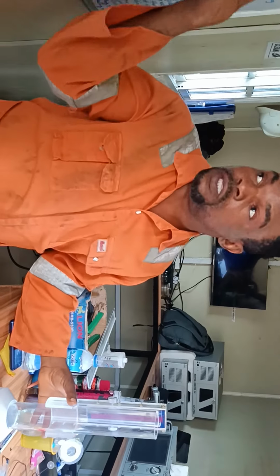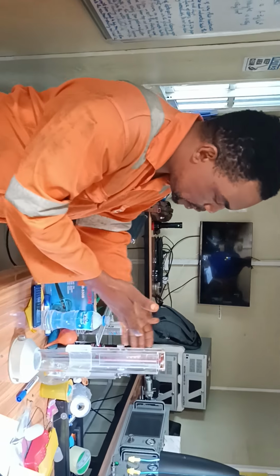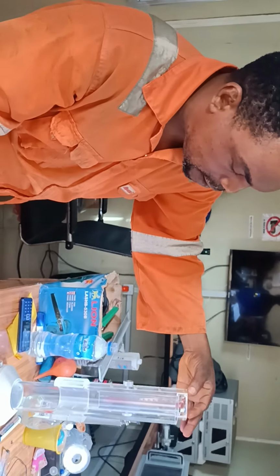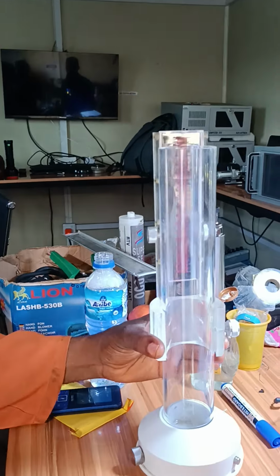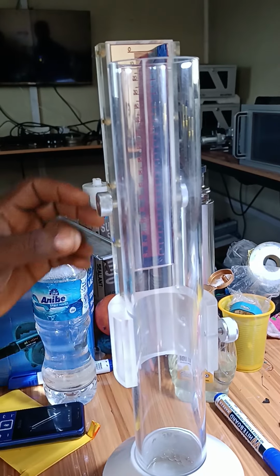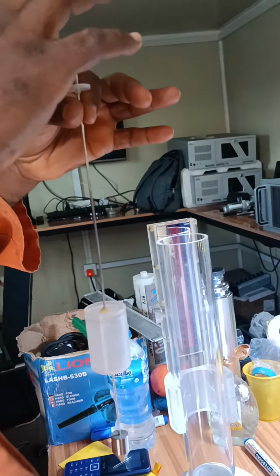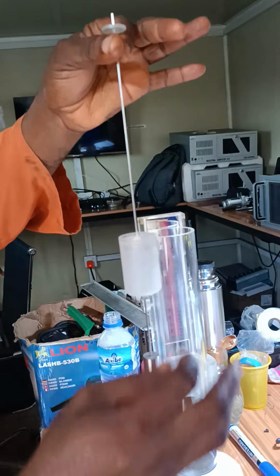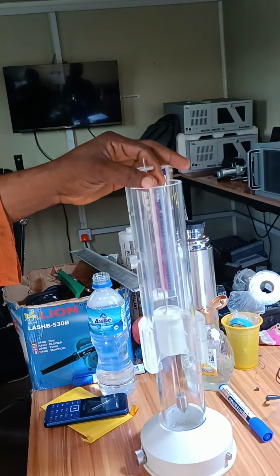You can see all we discuss here in the graphical picture. See the mirror and the scale divisions, from 0 to 160. Then you can see this is the bracket. Also you can see the adjustment mirror. Then this is your floater. This is the small tray. This is the floater itself. And this is the big tray. Here is your damping hammer. Usually this thing goes in like this.